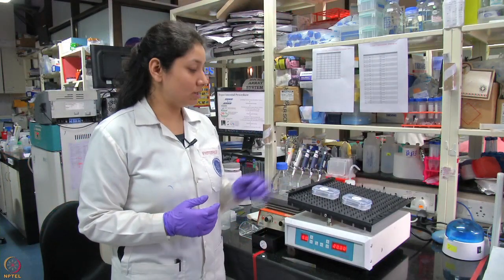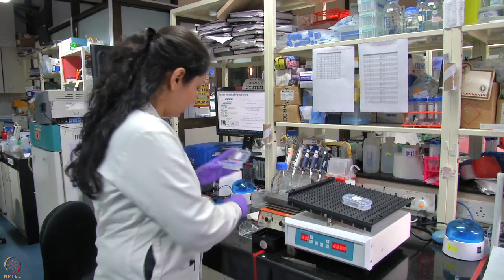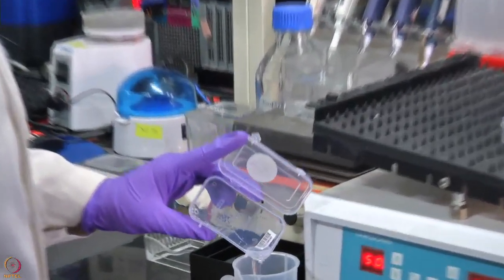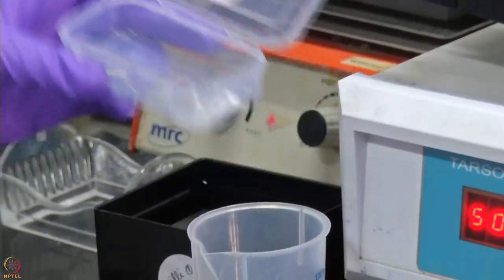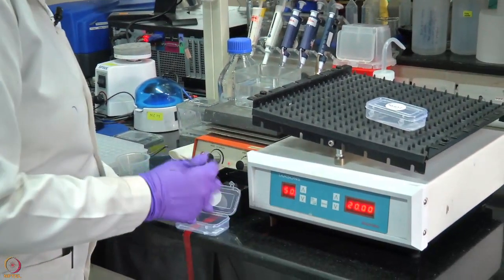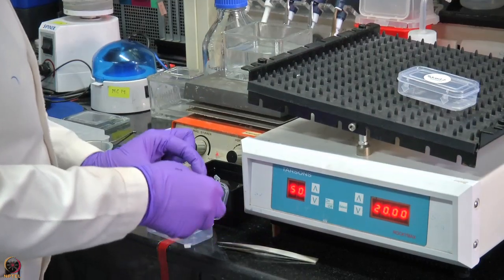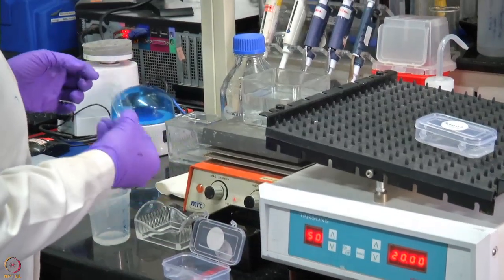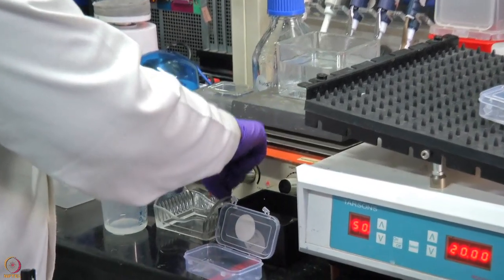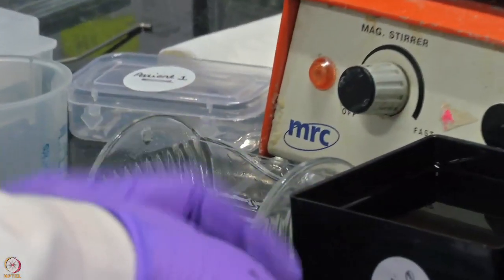Once the blocking step is completed, we take the blocking buffer out and carefully decant it. Make sure the slide does not fall and the blocking buffer is removed properly. Take the slide carefully without touching the protein spots — touch only at the barcode region — and replace the slide carefully into the cassette. We do the same for the second patient.